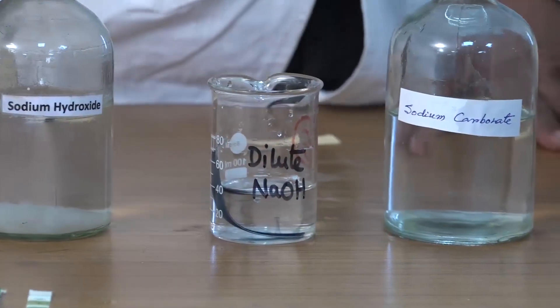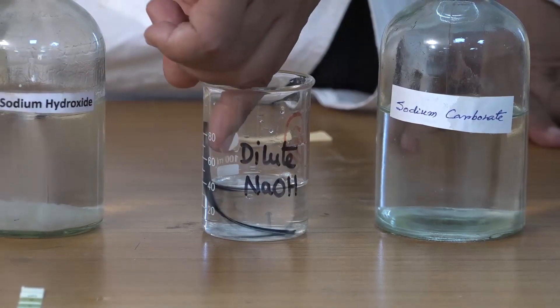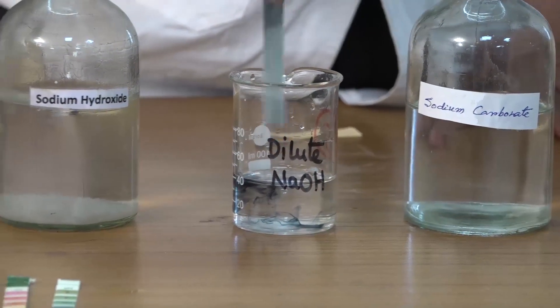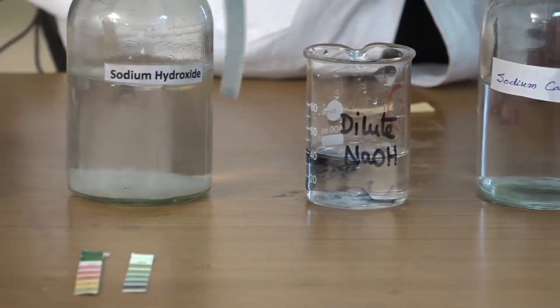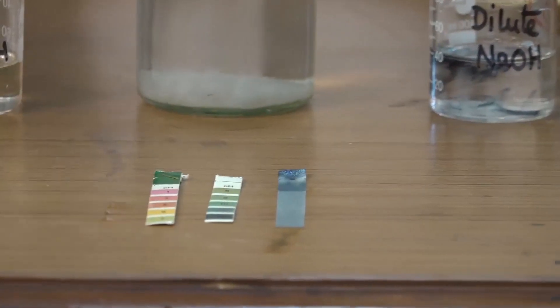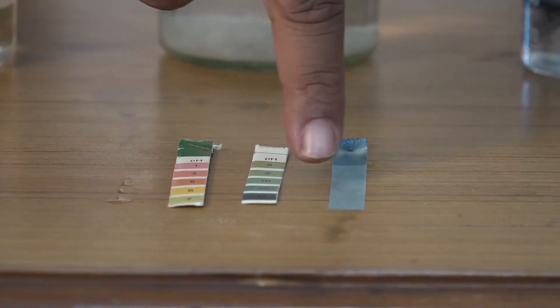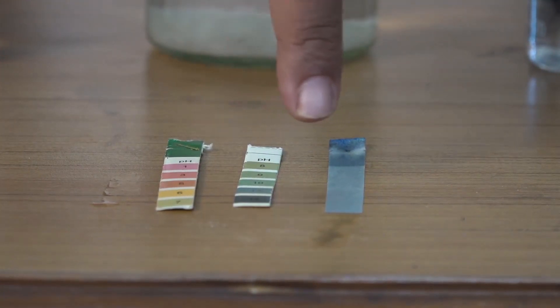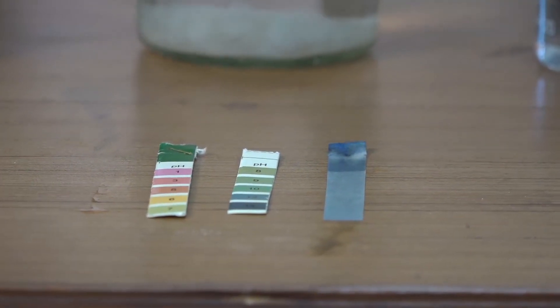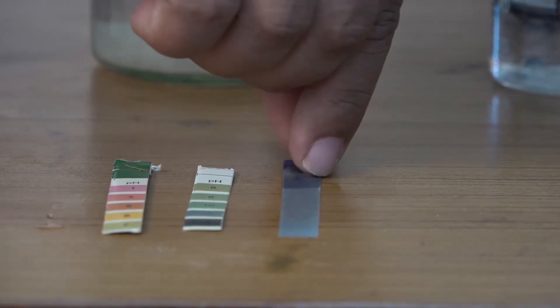Next I am collecting the pH paper from the sodium hydroxide solution and matching the color with the pH scale. This color is almost matching with the pH of 12. That means it is above 7, so it is basic in nature.